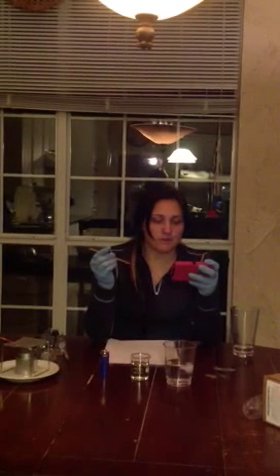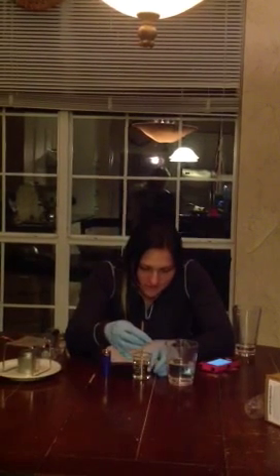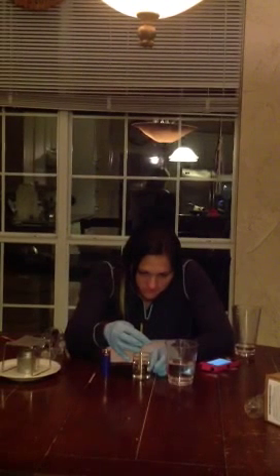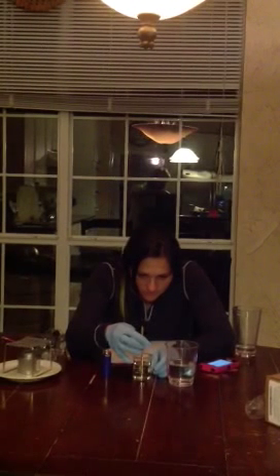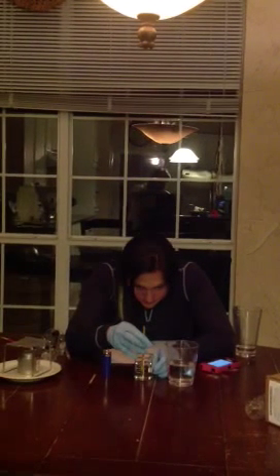And the measurement will be complete when the thermometer remains the same temperature without changing. So we're going to do that right now. We're going to watch it rise. So it looks like it's approximately 30.1 degrees Celsius.